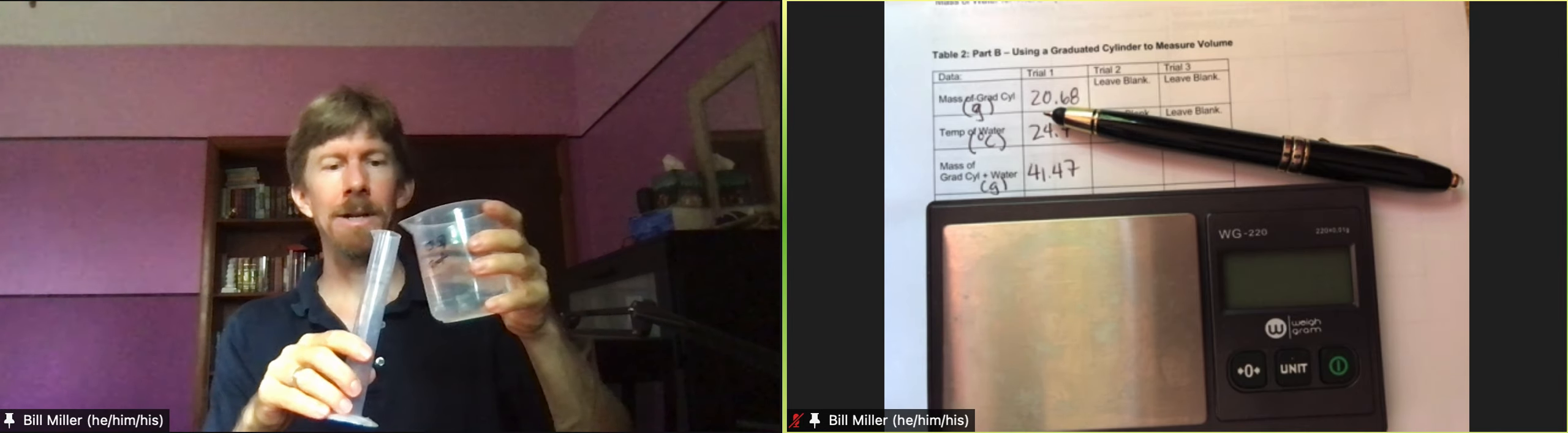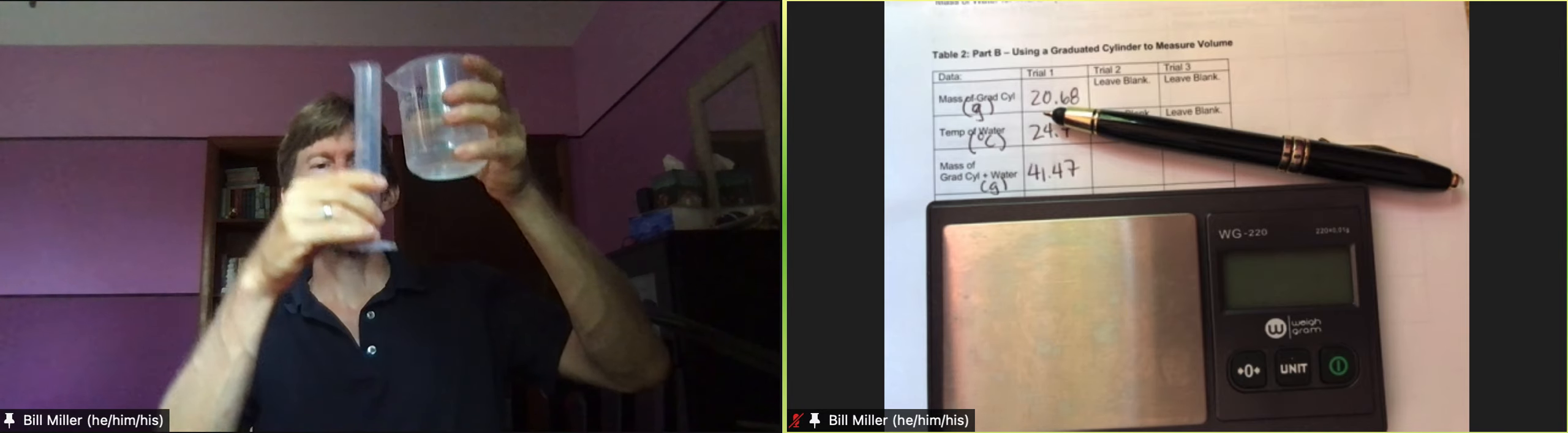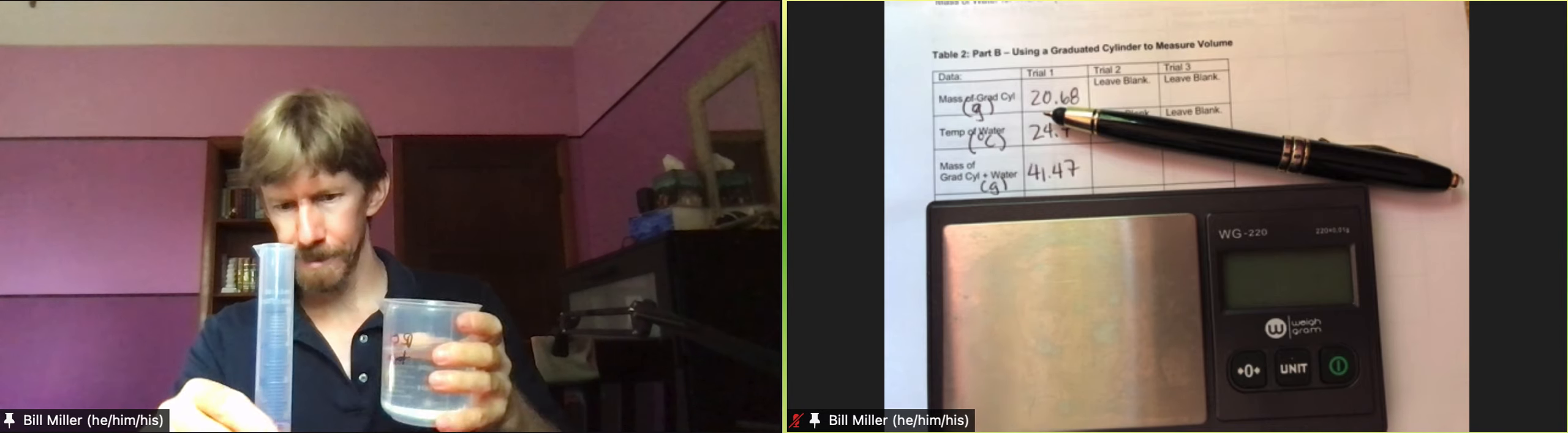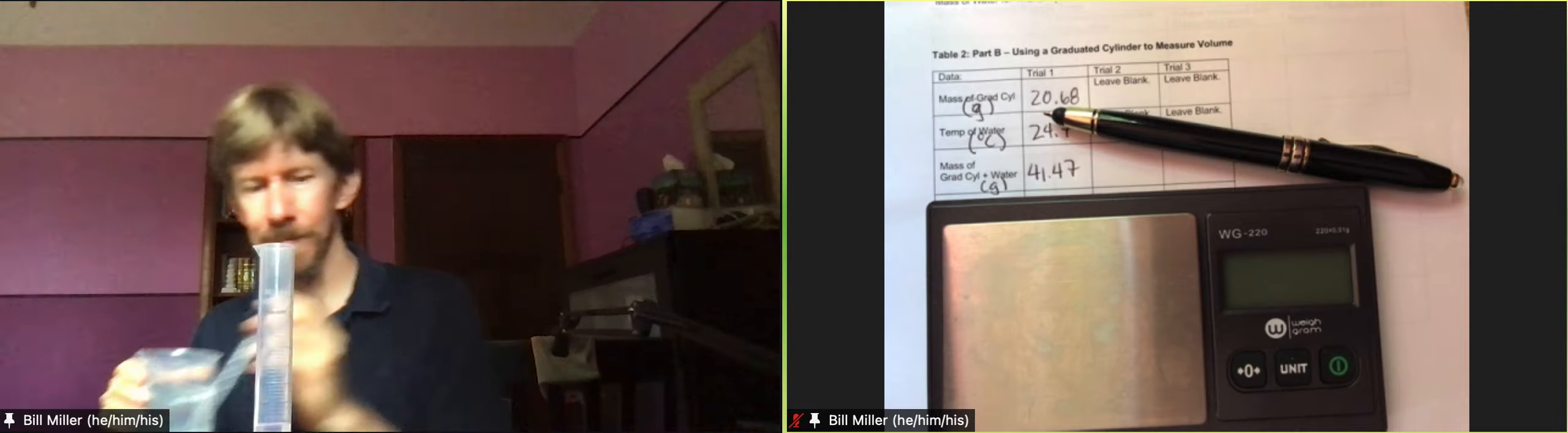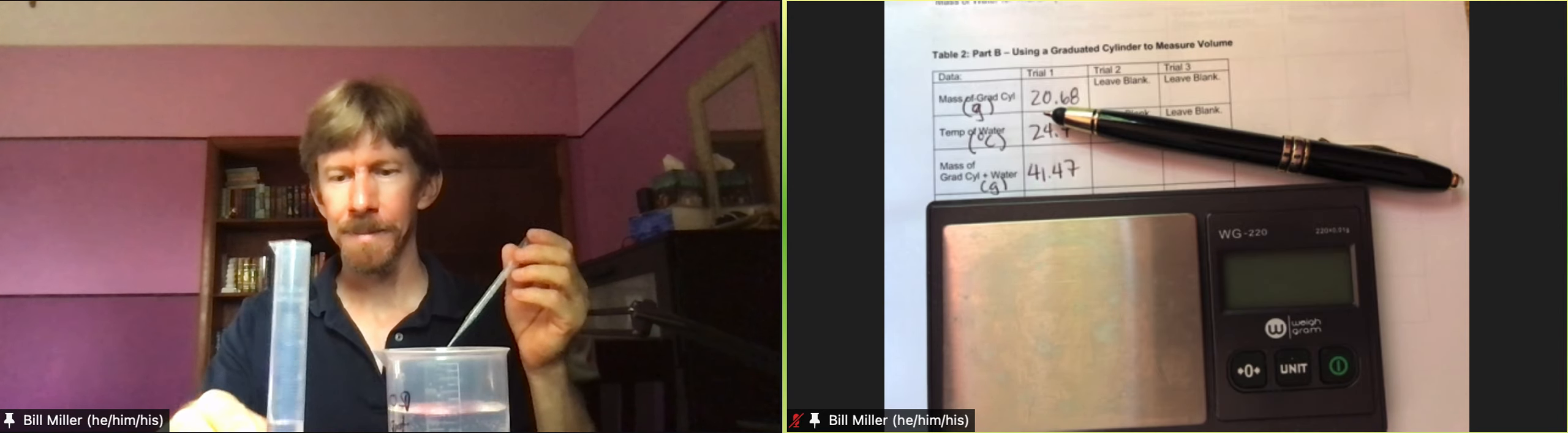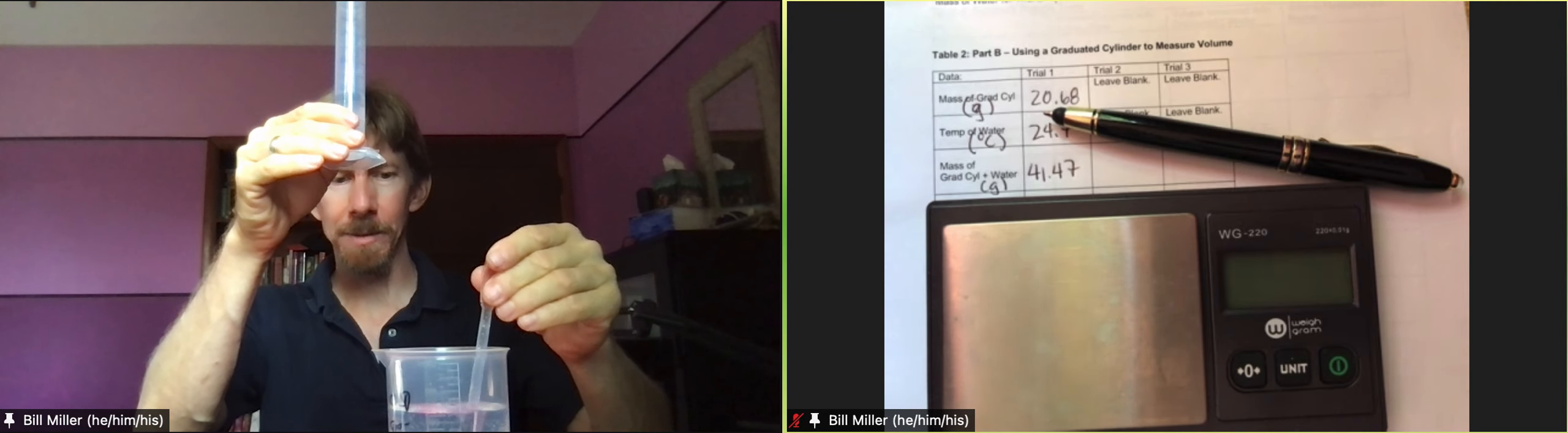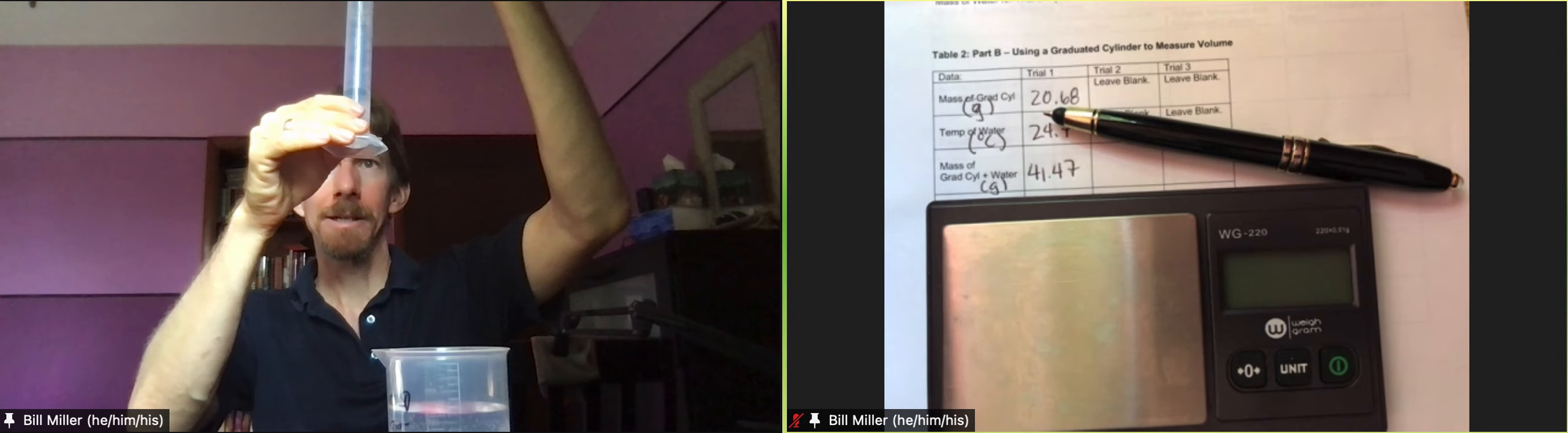I guess I do have to take that out, pour in 20 more milliliters. This time I'm a little farther away from 20, and this time I'm going to pick it up and add my 20 like this.